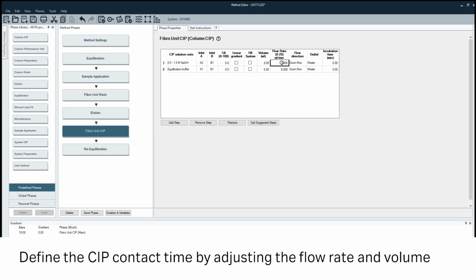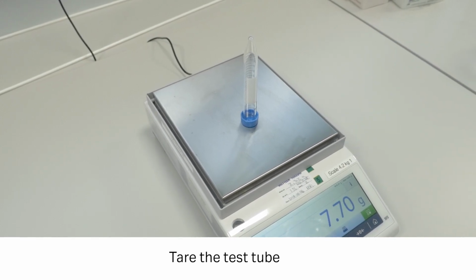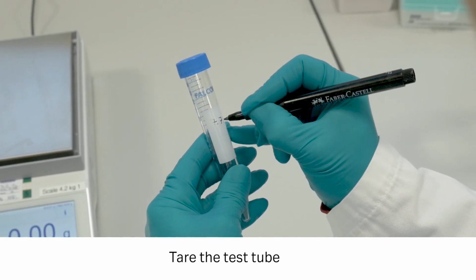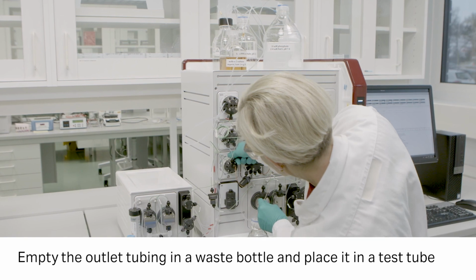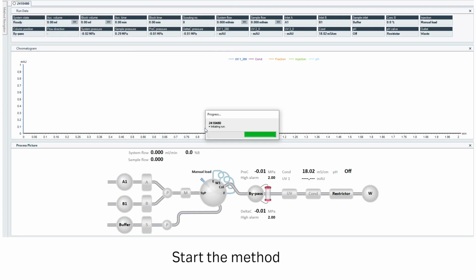Use a flow rate of 16 or 8 milliliters per minute during CIP to obtain a CIP contact time of 0.5 or 1 minute. Tare the test tube in which you will collect your eluate. Empty the outlet tubing. Start the method.